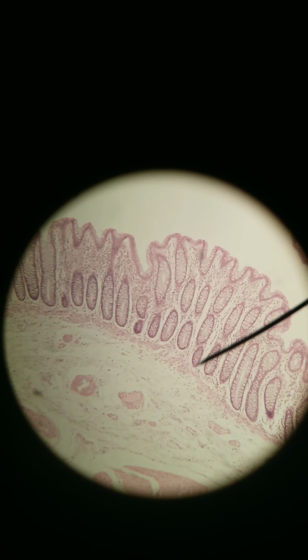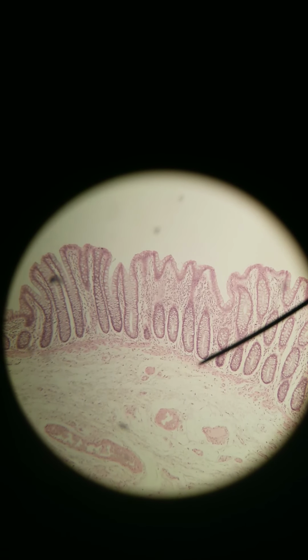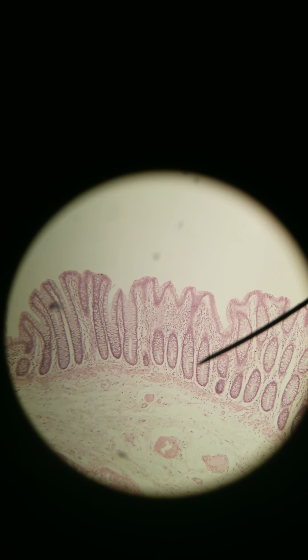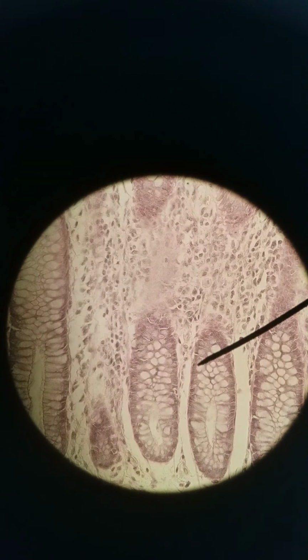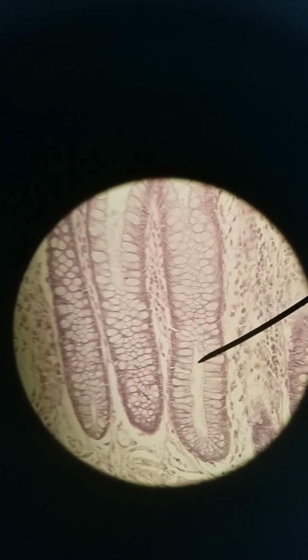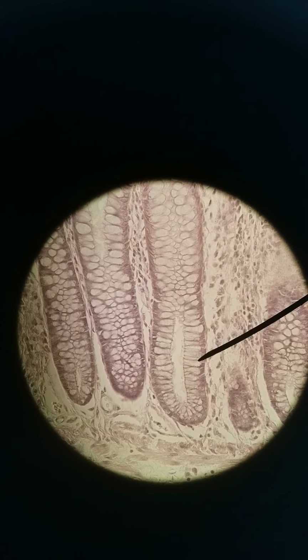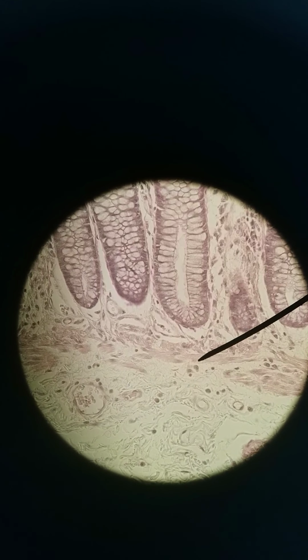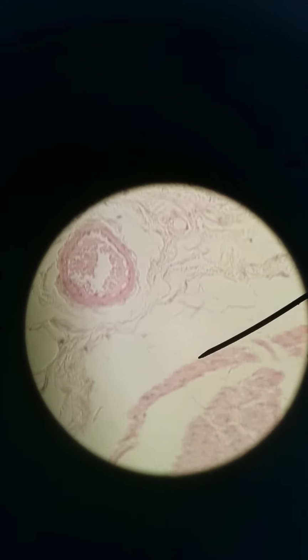All right. And then, once again, muscularis mucosa is right there where the arrow is, and then go down, and there's muscularis externa. Lots and lots of muscle. You've got to propel what's to become the feces forward. Going to 400X. At 400X, you can see the crypts full of goblet cells next to the simple columnar. Lamina propria, muscularis mucosa, thin layer, submucosa, blood vessel, muscularis externa, smooth muscle.